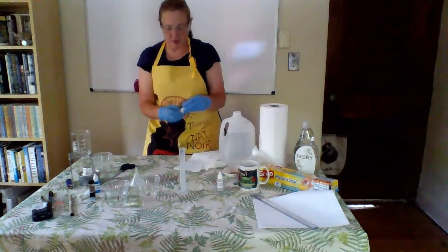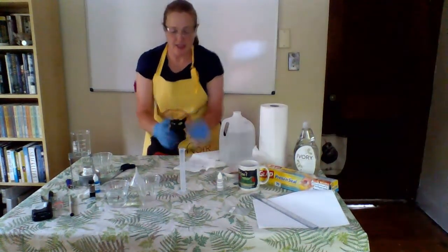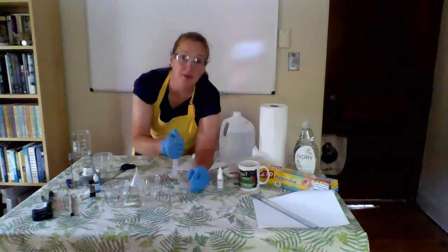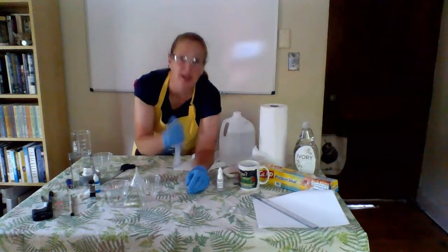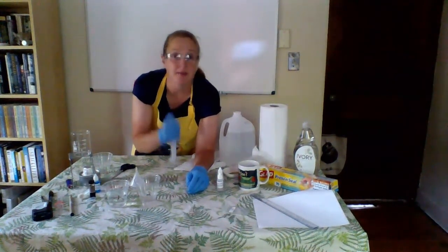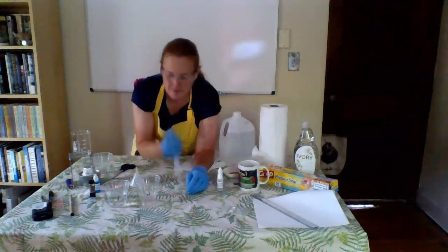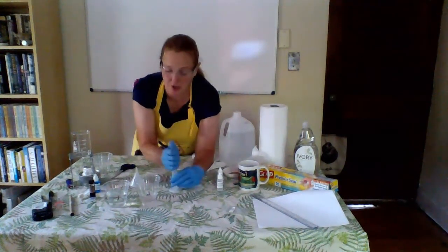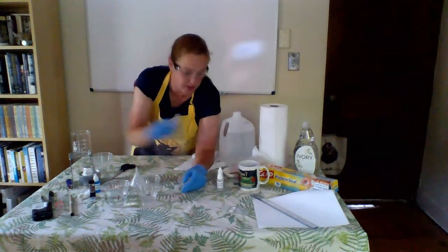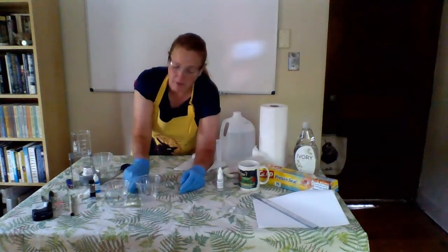And I know that what I need to do is get all of these compounds thoroughly mixed up. So I'm going to put my thumb over the top and give this a little bit of a shake. Start getting this really mixed up. I'm going to dump this into container 2. If I wanted to, I could take that stir rod and stir it around again. Just want to make sure that these contents are really well mixed up.